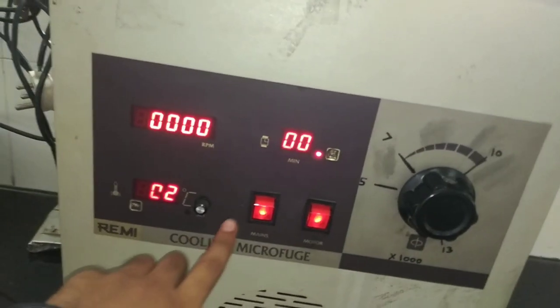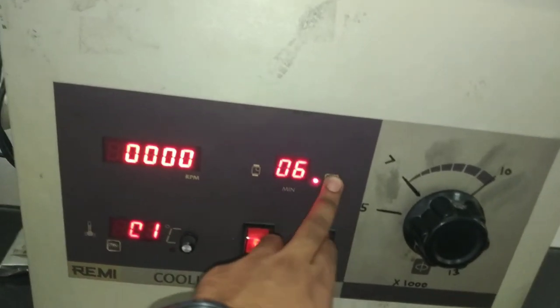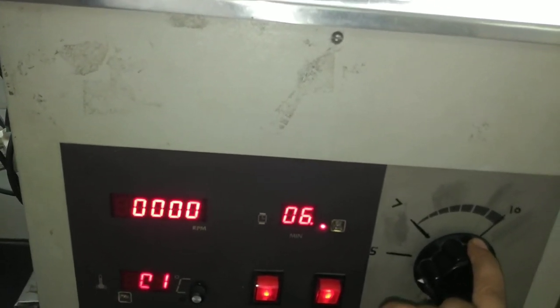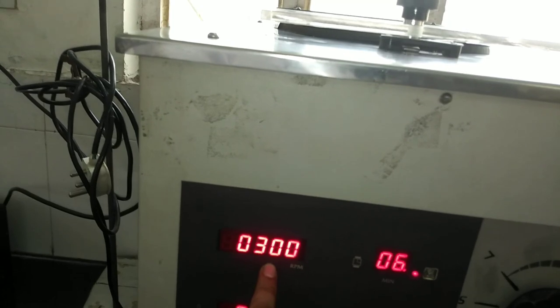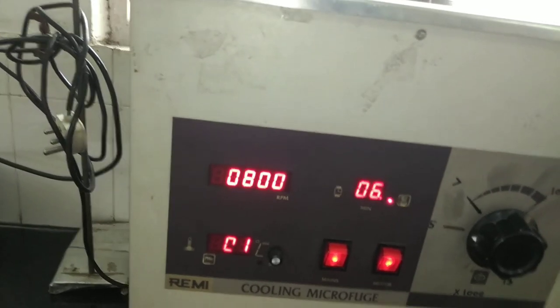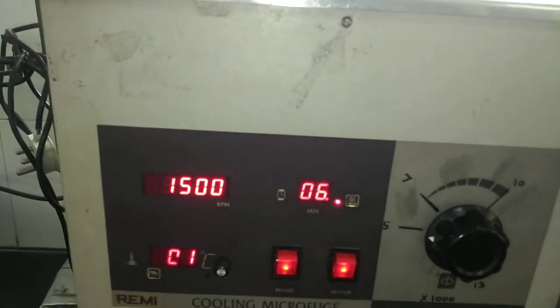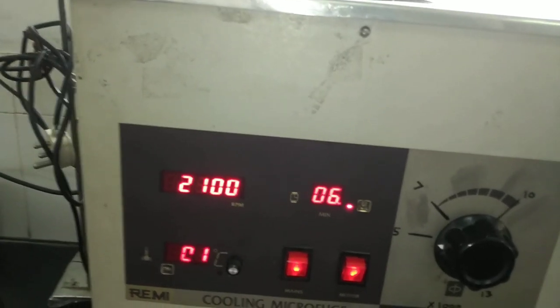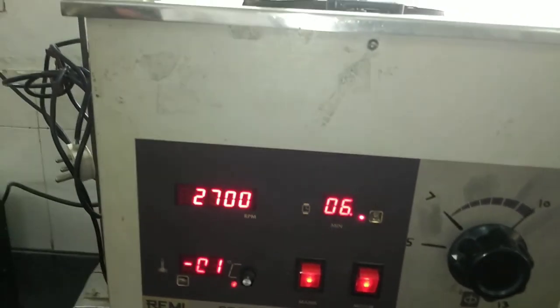After placing the tubes, turn it on. First switch it on, and then set the timer from here. Very slowly rotate the speed roller so the RPM starts to increase — 100, 200, 300 — and it can go much higher. After the centrifugation time you set is complete, it automatically stops. Then take the Eppendorf tubes out and observe the results — the pellet or the supernatant, whatever is required.